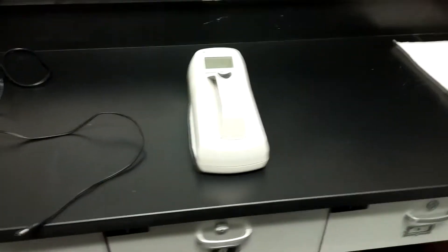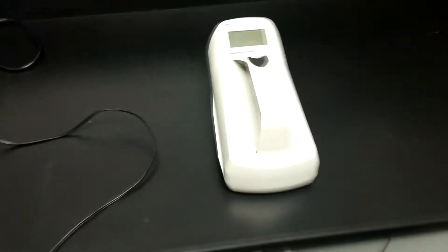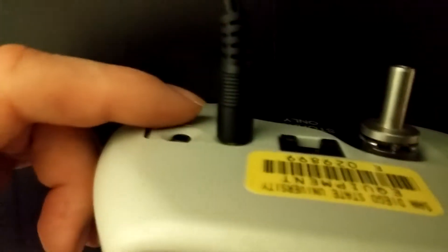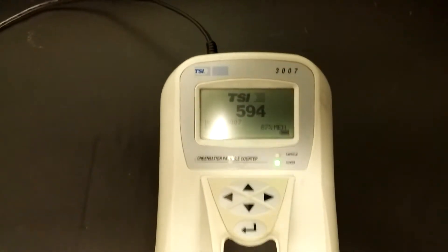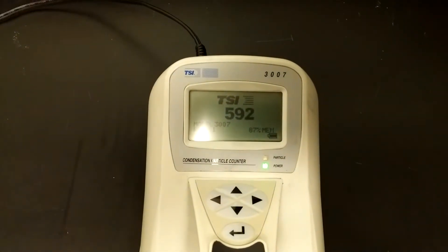The first step is to turn the CPC on. Since I'm indoors, I'm going to plug the power jack into the back to save battery power, and then press the power button which is on the right side. You'll notice a countdown on the screen — that's the number of seconds before the CPC is fully booted up, which equates to 10 minutes.